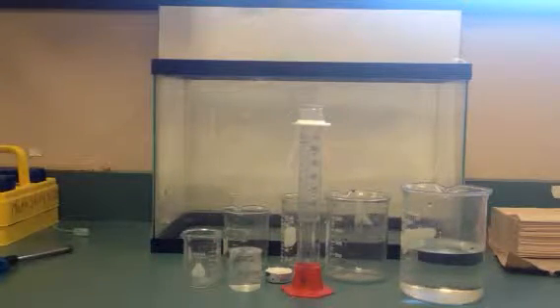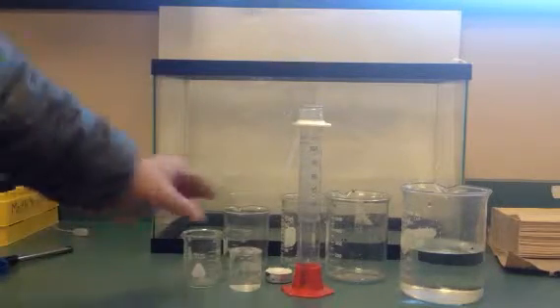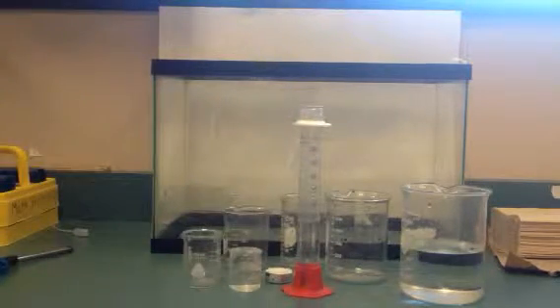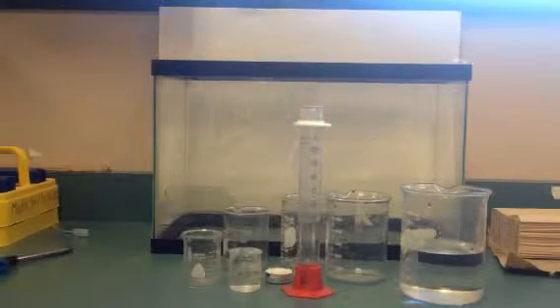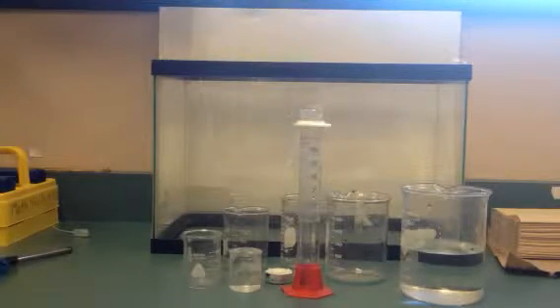And so you can use this little video tutorial to at least be able to write up some procedures of how we calculated the volume of the actual beakers themselves, and then you can get the real data for the real volumes on the makeup data.